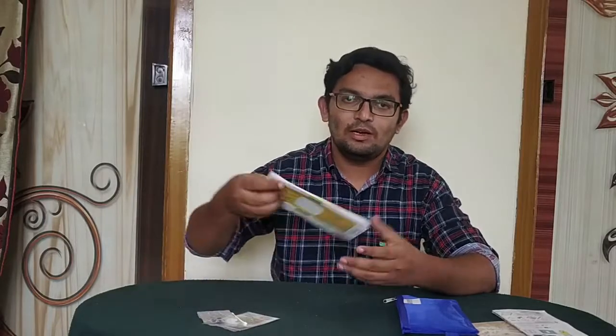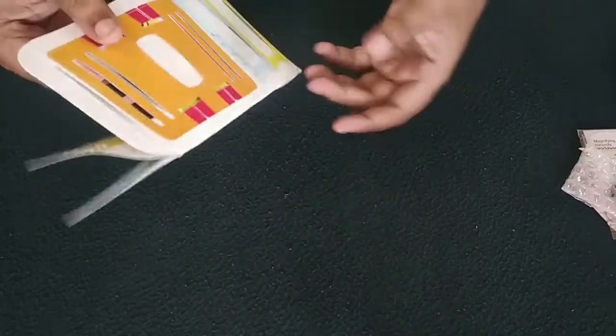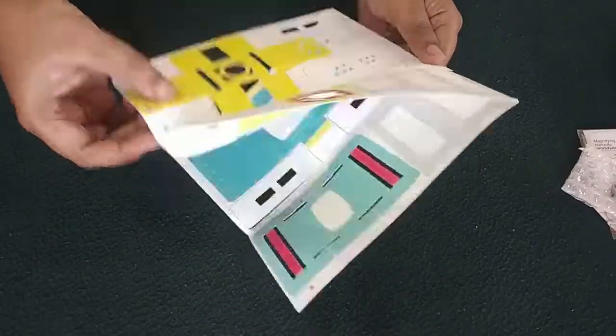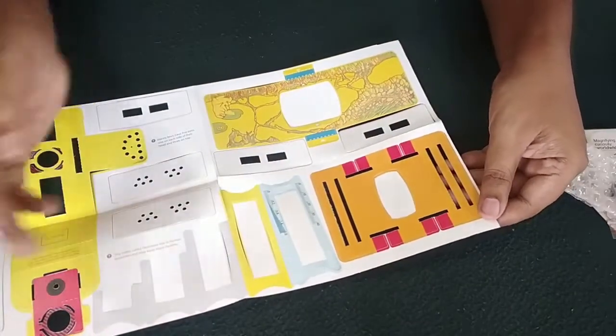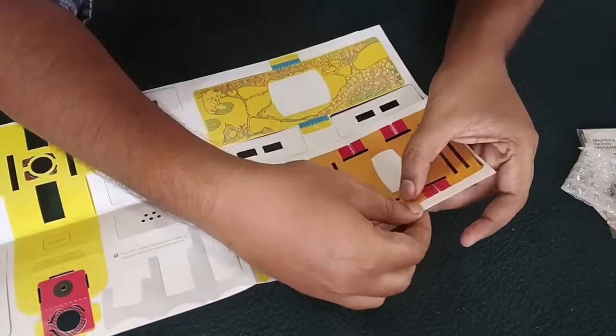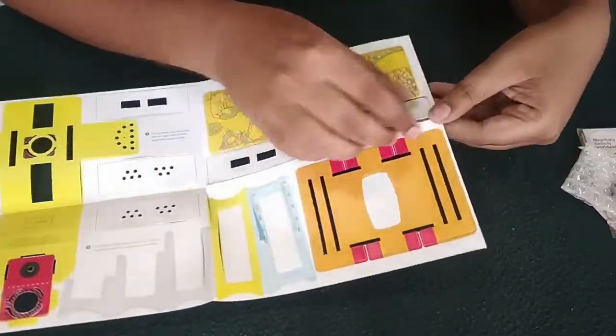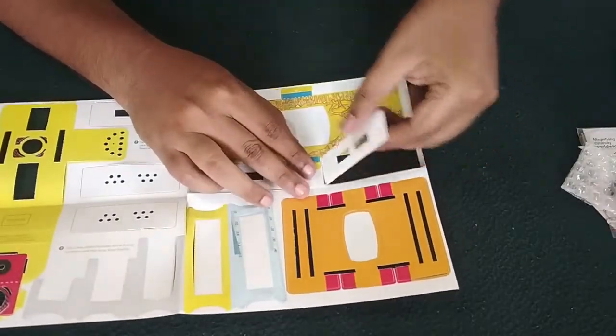Come, let's begin to assemble this kit. First, let us pair all these things which are present in this. These are all the things present in that kit, so let us take out everything. Be very careful not to tear anything.